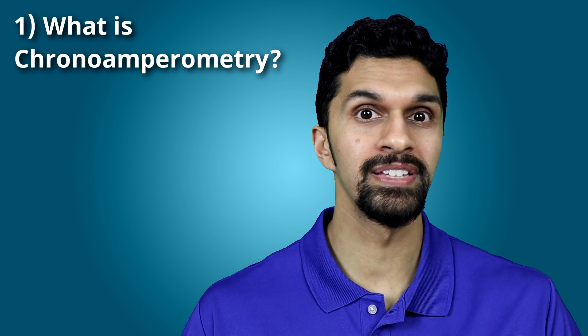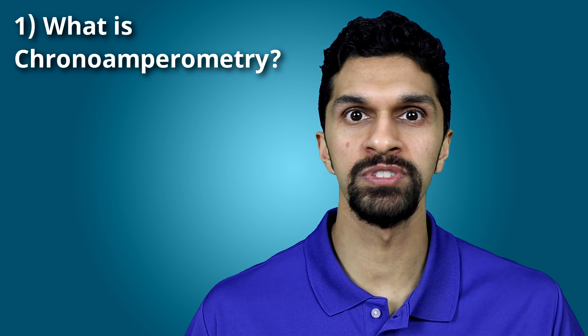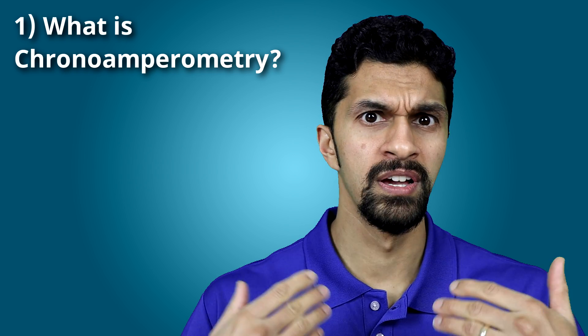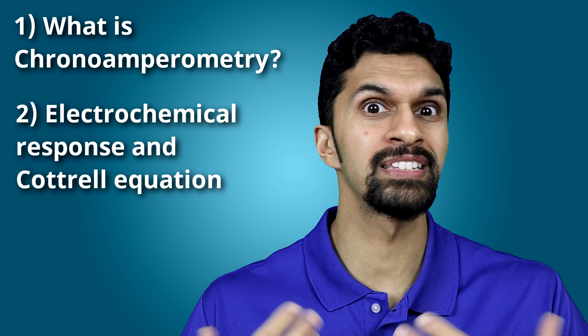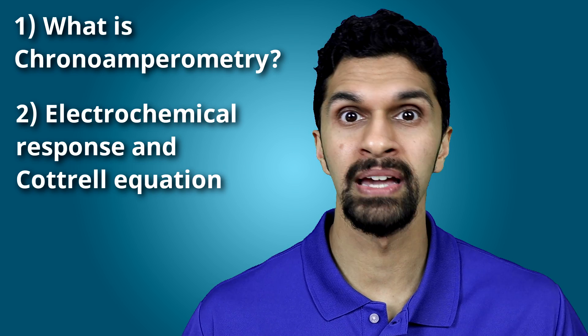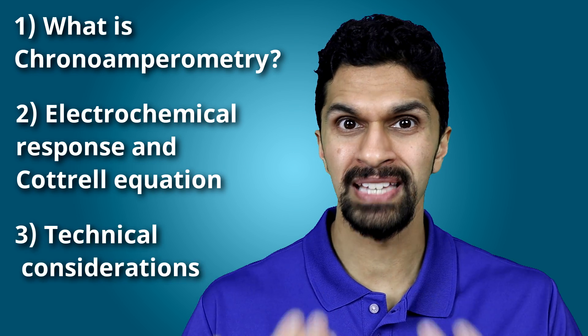In this video we're going to talk about chronoamperometry — specifically what it is and how the technique is used. This video is broken up into several sections: first, what is chronoamperometry and what is the potentiostat doing to our electrochemical system; the response it gives; the electrochemical processes that produce that response; the mathematical theory behind it; and finally, some technical issues to consider when doing chronoamperometry.